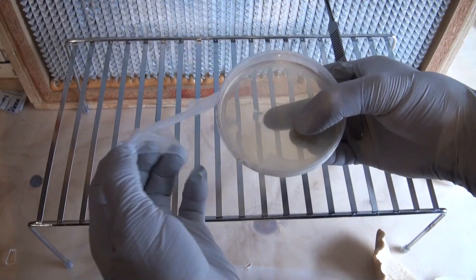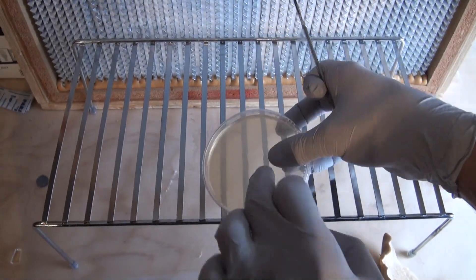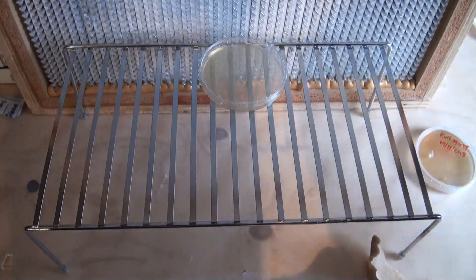Also, when you're cloning, it's pretty important to keep the dirtiest things as far downstream as you can. So the agar plate is going to be right up against the laminar flow hood, and I'm going to be moving everything behind that. So I'm going to tear the mushroom downstream of the flow, cut a piece of tissue, and bring it upstream of the flow onto the agar plate, which will kind of minimize the potential contamination that we might have.